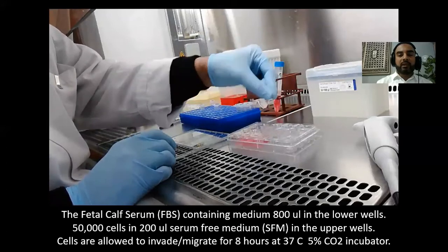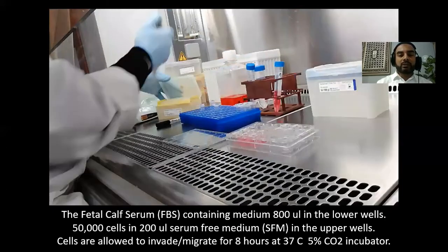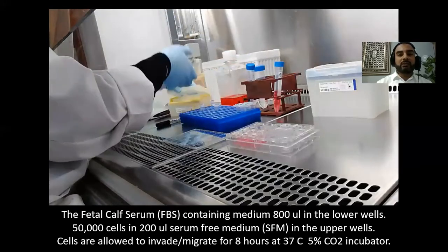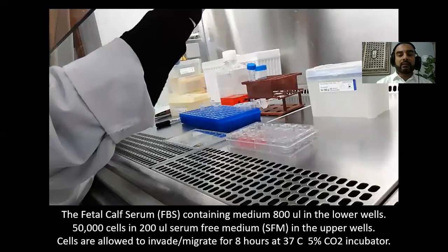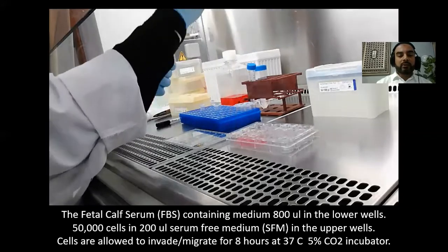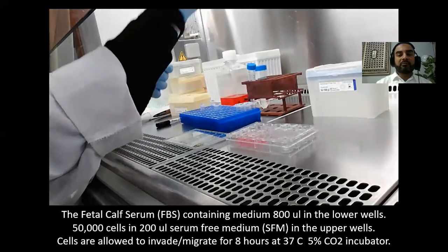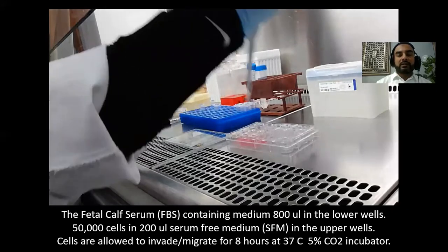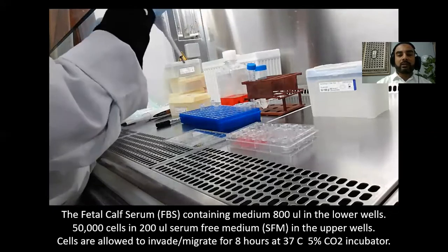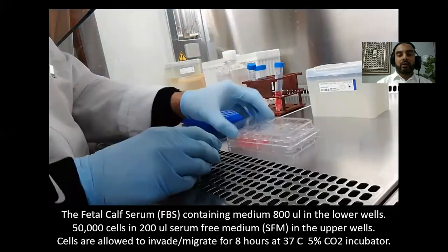The next step is to put the cells in. We have the control cells and then the knockdown cells for STIM1, which is a calcium sensor protein. We will put those cells into the respective inserts — 200 microliters containing 50,000 cells. The cells are in serum-free medium, so they will migrate towards the lower well where the normal medium with serum acts as a chemoattractant.